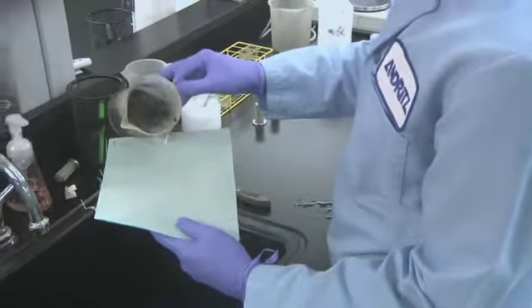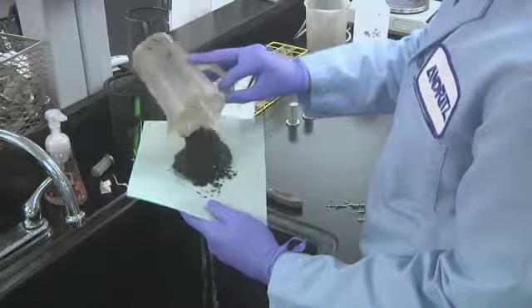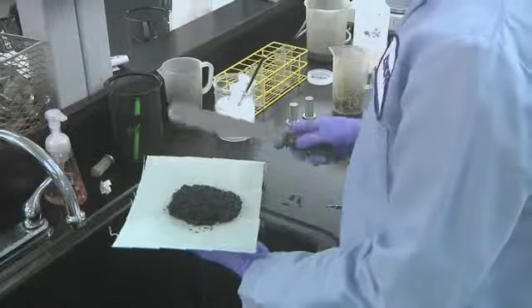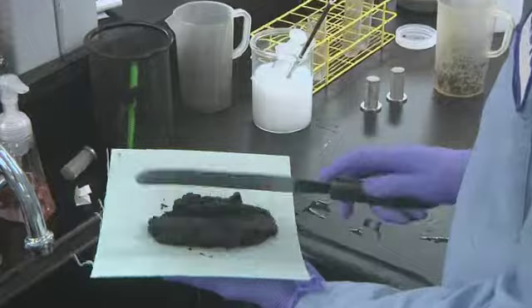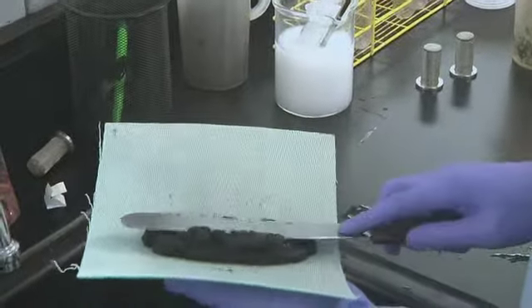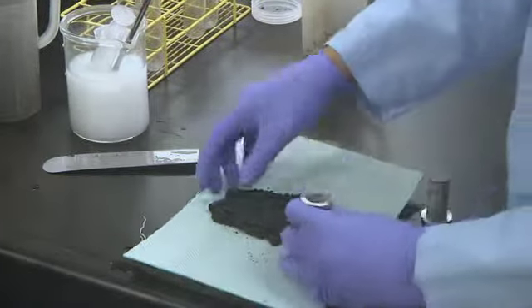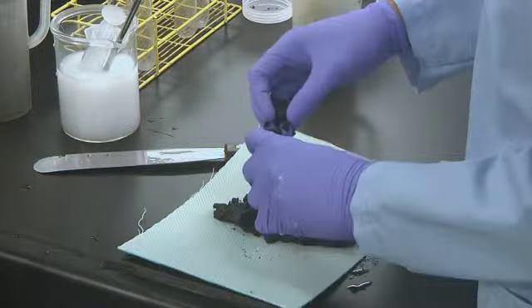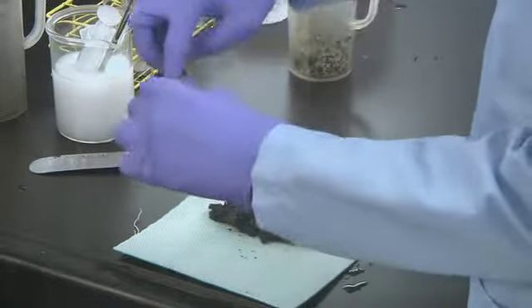The flocculated sample from shear testing is thickened over a filter fabric. The screen tubes are then filled with the thickened solids. The screen tubes allow simulation of the beach or incline section of the centrifuge.